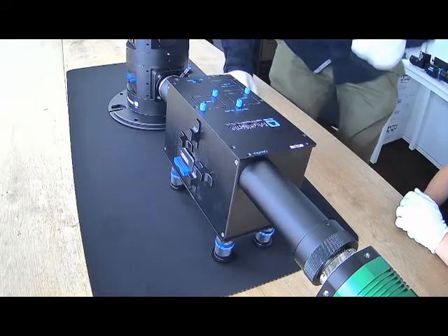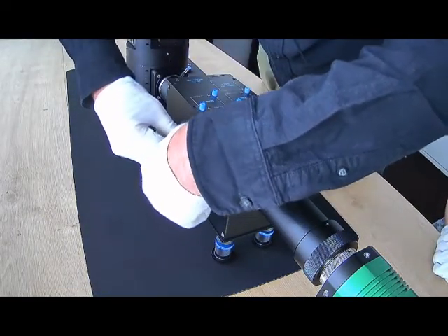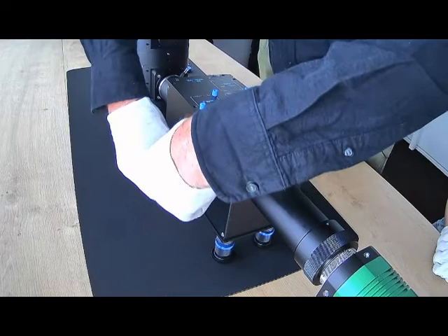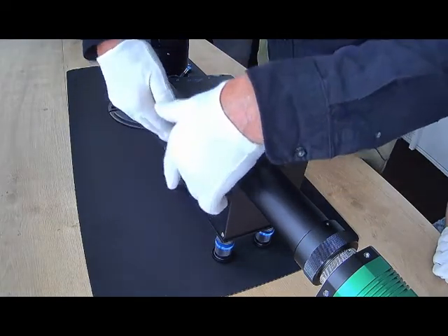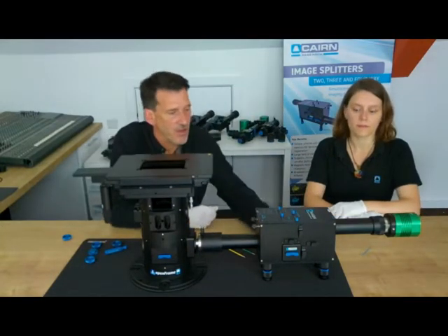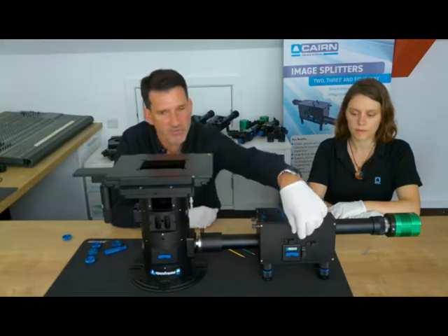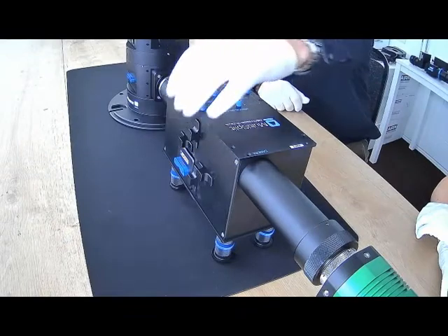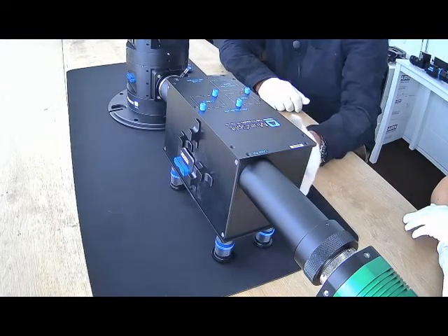As with our other splitters, we have individual component positions. With 4 colours, the requirement to do chromatic correction between channels becomes more paramount because it's likely to be an infrared channel and a blue channel, and there can be a reasonable chromatic separation. So these positions here allow you to insert lenses in to correct the focus between them.